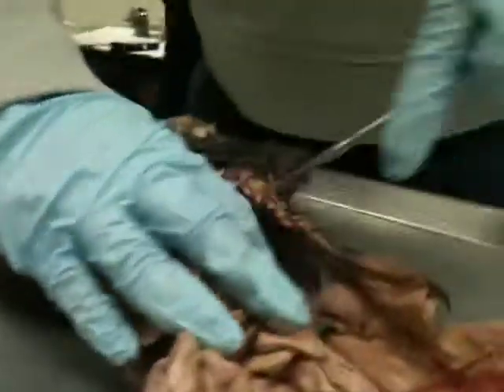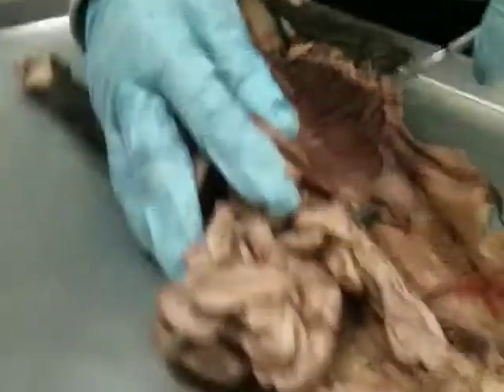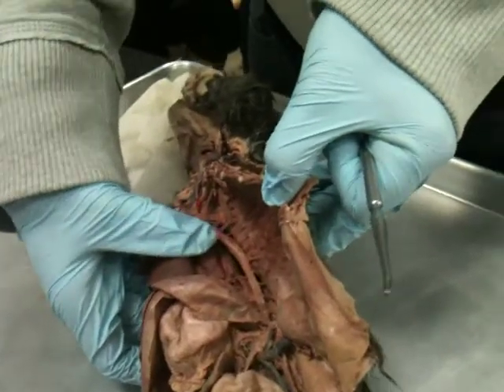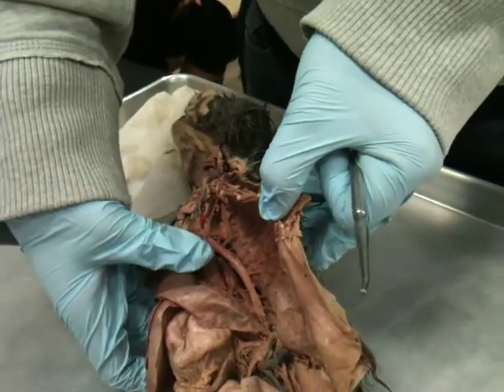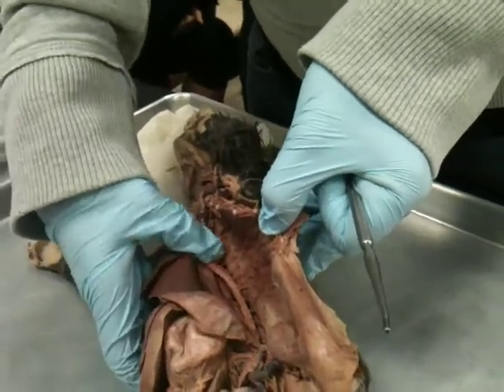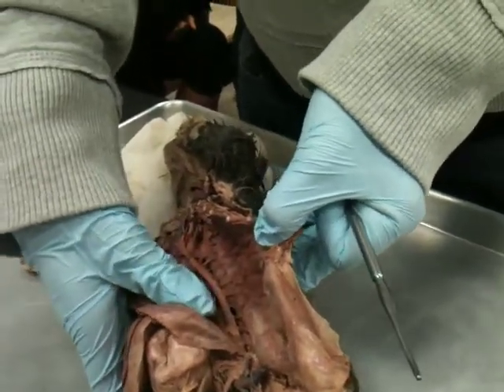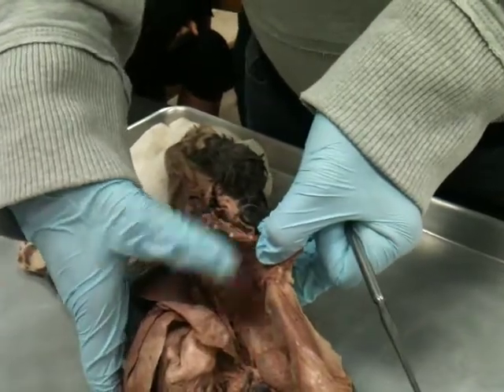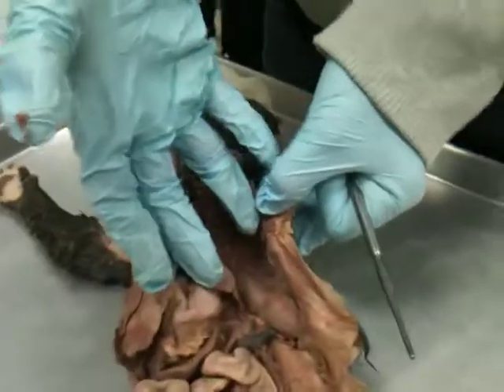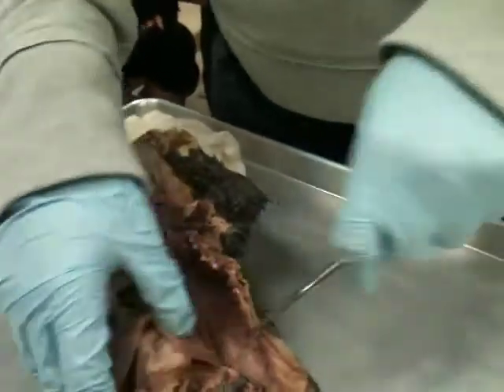All right, so that's pretty much the hardest part, I think. Then you can follow this down. When you look in here, you can see all those tiny little branches coming off the aorta that go in between the ribs. So what do you think those are called? Intercostals. Intercostal arteries, right? So there's a bunch of them. Each rib essentially has one, and they follow the ribs all the way along, giving oxygen to that intercostal muscle.